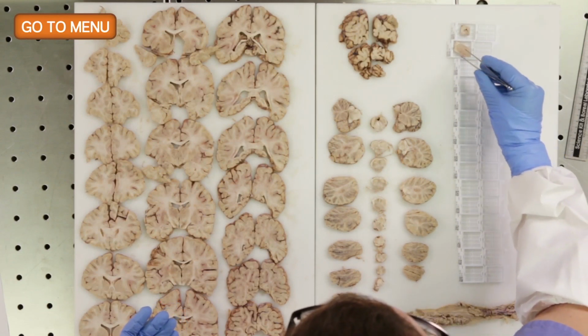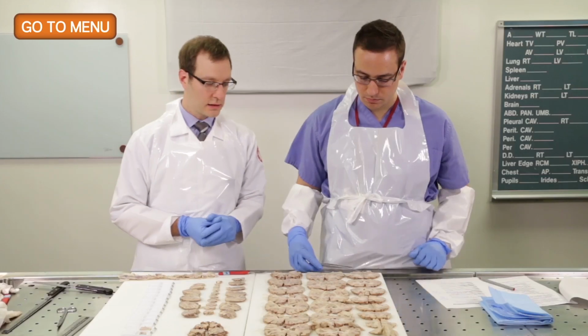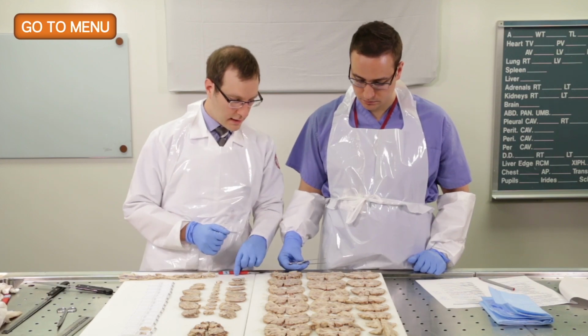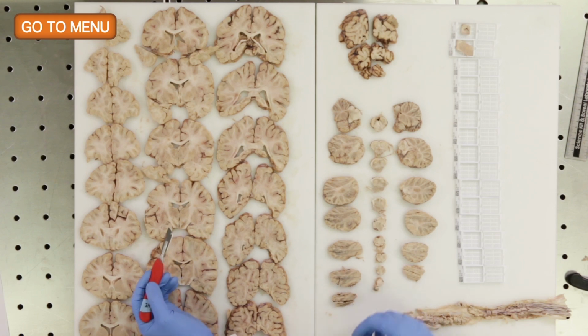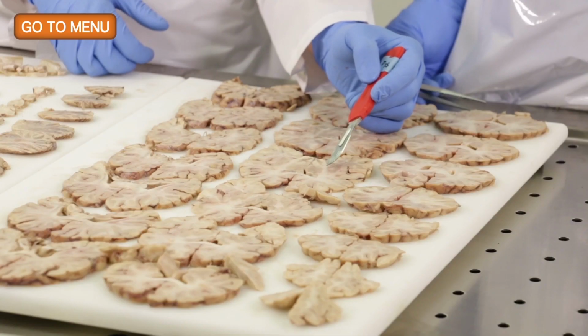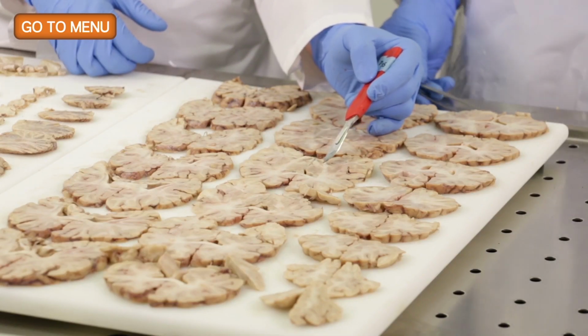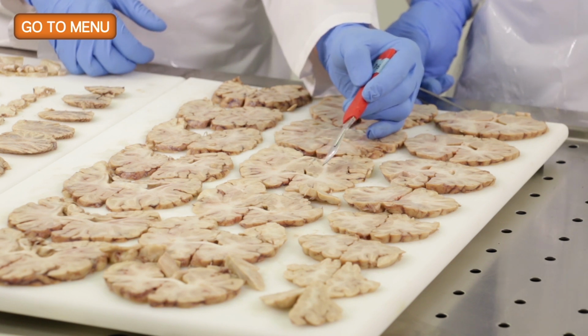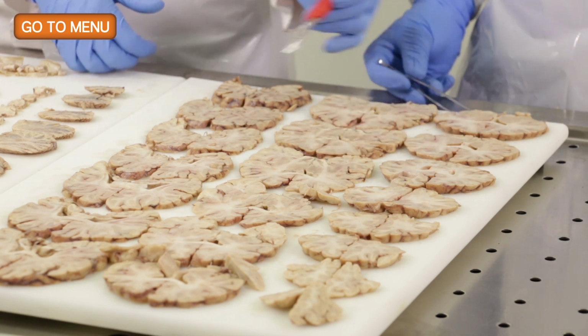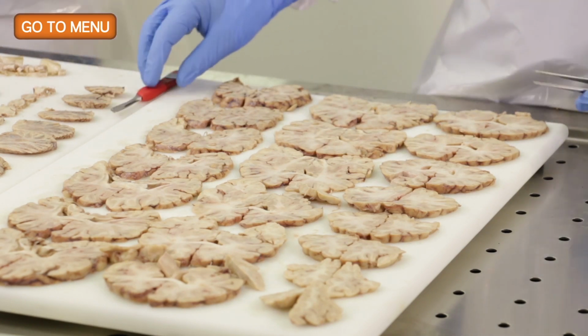So the third section that we'll take routinely is a section of the thalamus, and I usually take a section in this region, and if you can, it's good to get part of the subthalamic nucleus, and you can get part of the caudate if you can fit it. If you can't fit the caudate, that's okay because we have it in a different section. So just focus on the thalamus, the subthalamic nucleus, and you'll also see part of the substantia nigra here and the red nucleus. So all of those are critical structures and worth sampling.